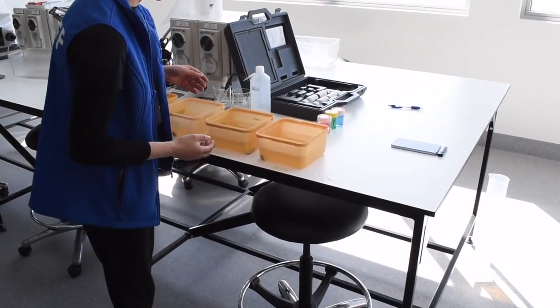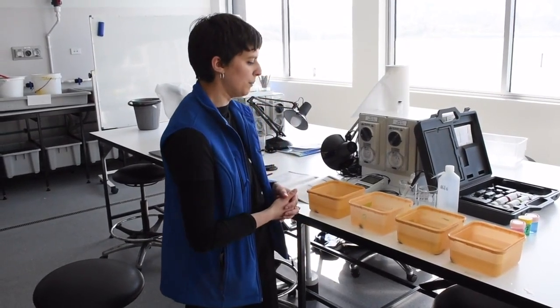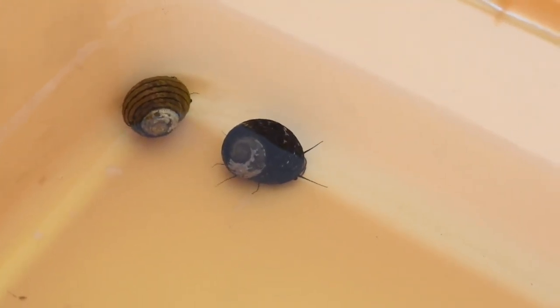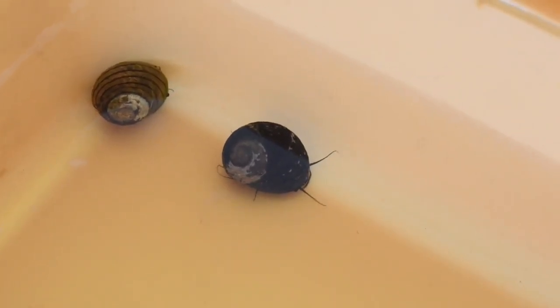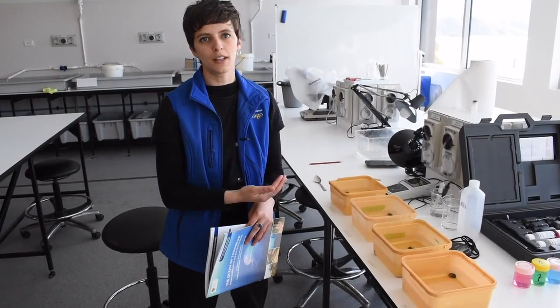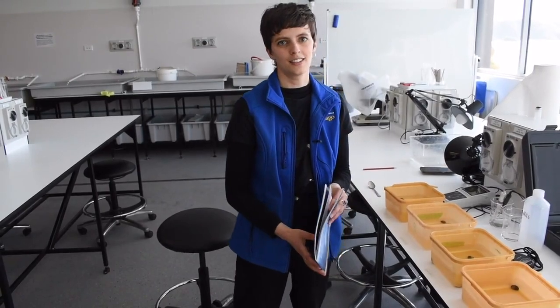In each of our containers we have 4 snails, and these are replicates for each of our treatments. Replicates are a really important part of doing an experiment. Before we go further, we want to make sure that our snails have a chance to acclimatize to each of the different treatments. So we put our snails into the treatments and leave them there for 15 minutes before we start with the turnover experiment, which gives them time to adjust to the different scenarios.